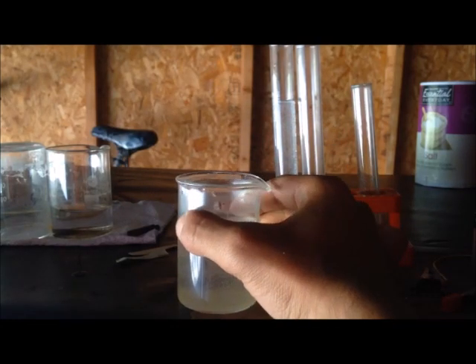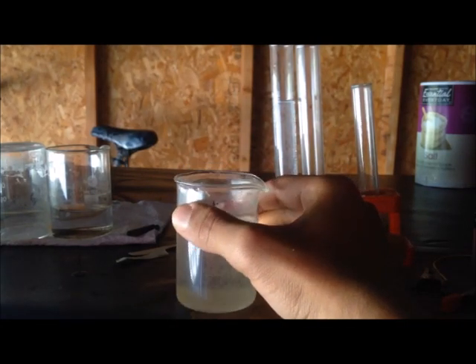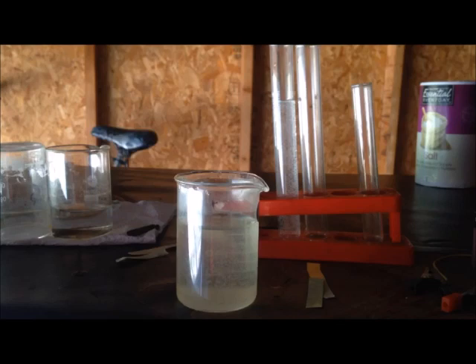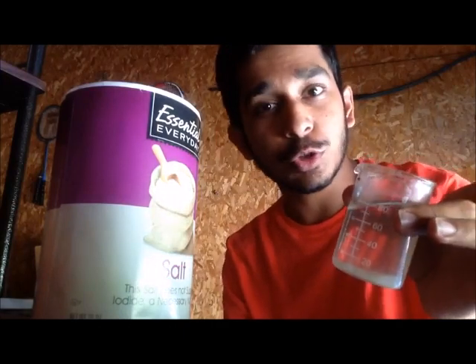We successfully made bleach using electrolysis of sodium chloride, but its concentration is quite low. This was a method of making low-concentration sodium hypochlorite from the electrolysis of sodium chloride. In fact, electrolysis is a fantastic way to synthesize chemicals which cannot be made otherwise using just chemical reactions.